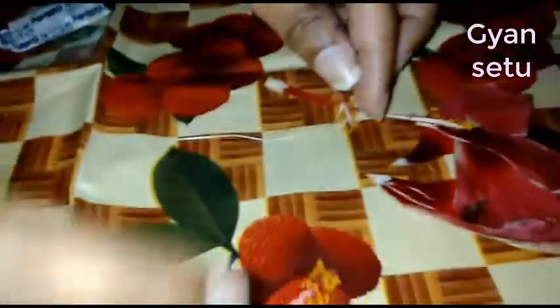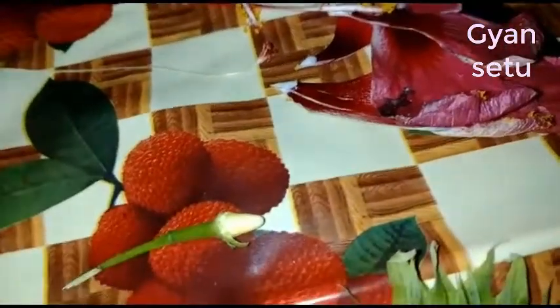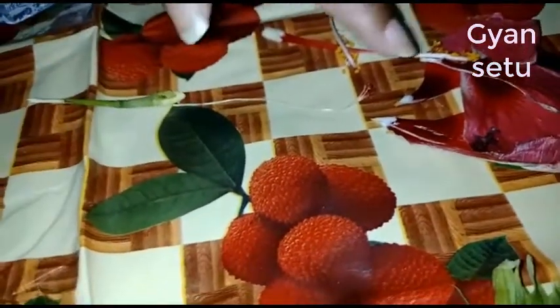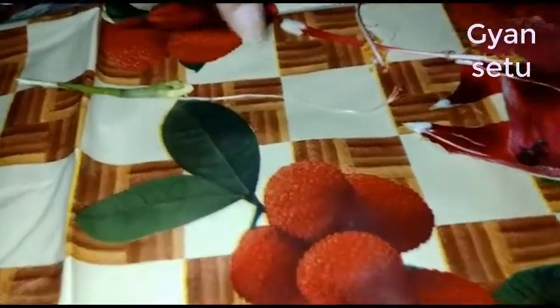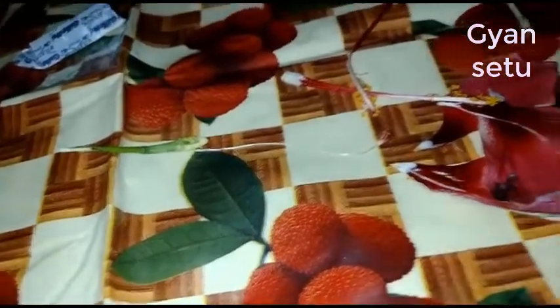This part is known as stigma and style, and you can see over here — this is your ovary. This part is basically known as the female reproductive system: stigma, style, and ovary. What about the male reproductive system? The male reproductive system consists of pollen grains.